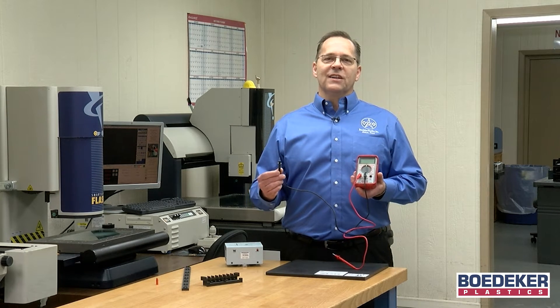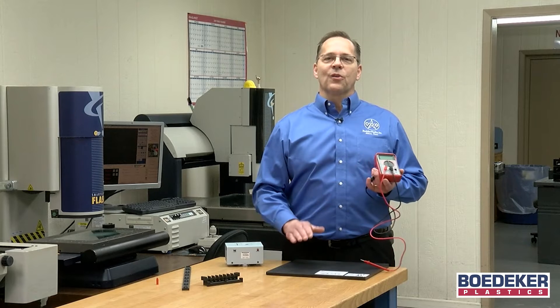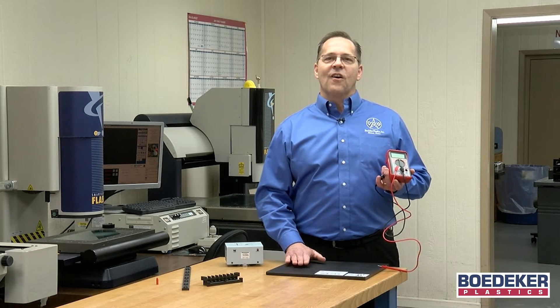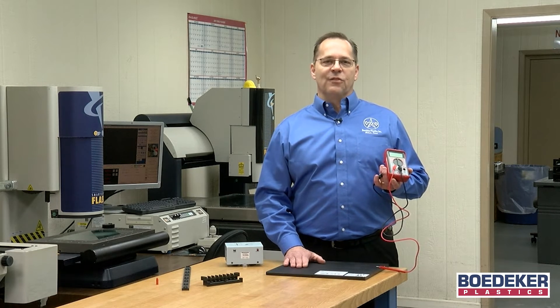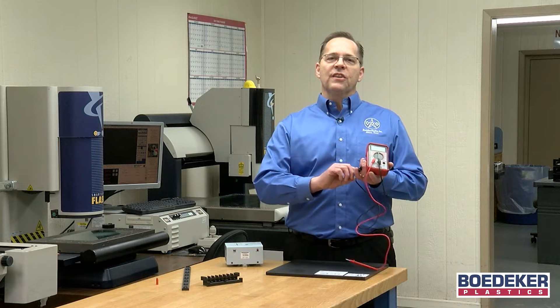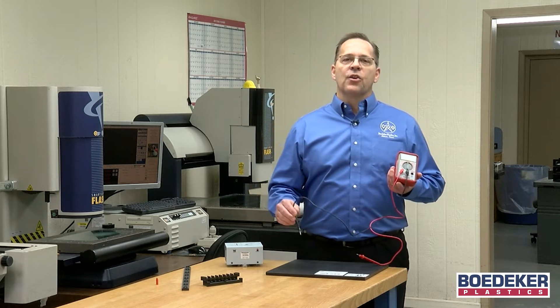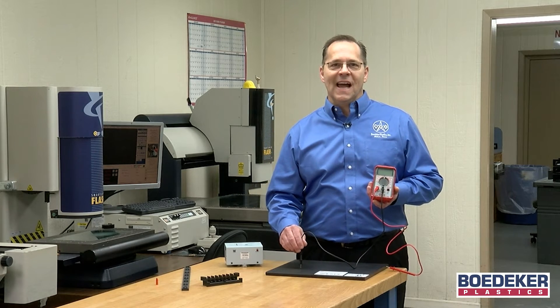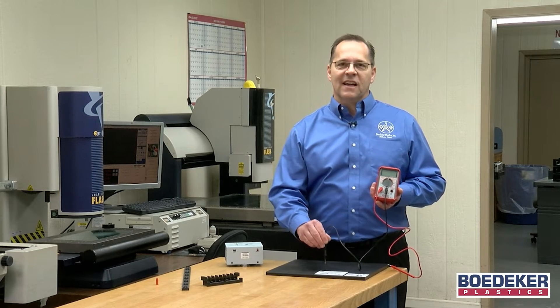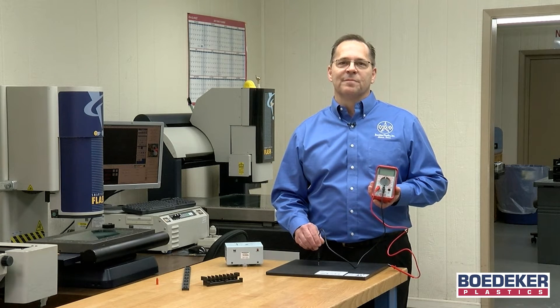Critical to understand is that ESD or static dissipative plastics are not considered fully homogeneous. When using such a point-to-point probe, your probe may or may not be in contact with conductive elements of the polymer.